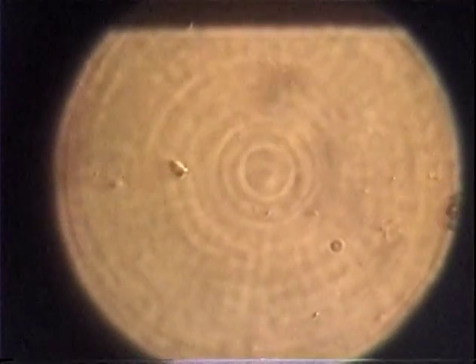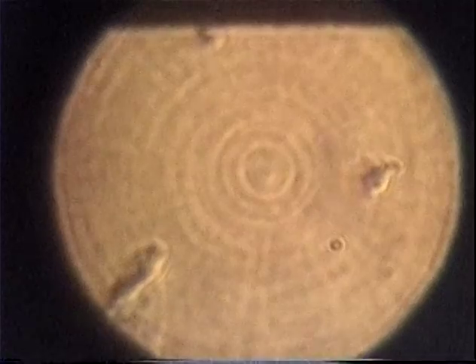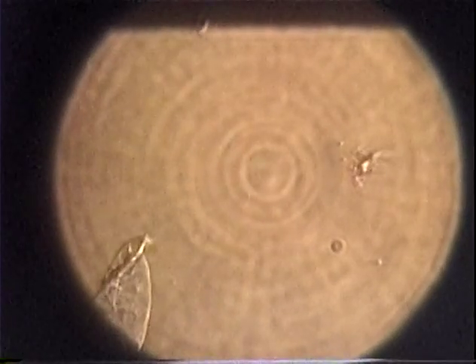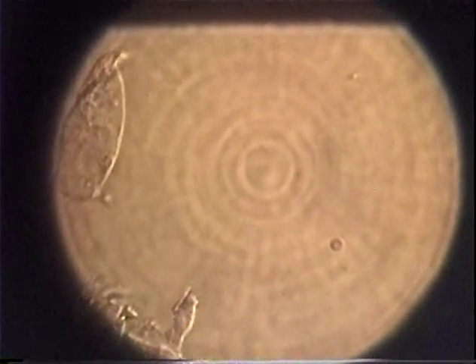I haven't seen much of mine. We did yours. That was the last one. We couldn't find anything. It's not your fault. You just need to shake it up more. Go back and resample yours if you would. I think we got an amoeba here, guys. Right, I'll take this with me. Resample it. You want to get a fresh slide? Wait, come get your slide. I've already gotten a slide.